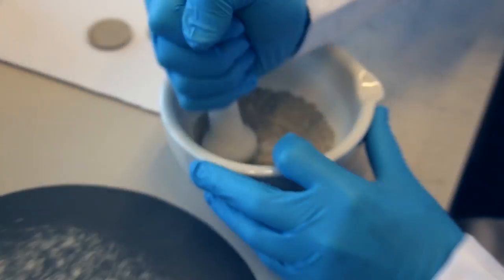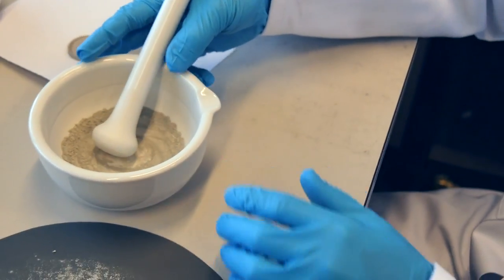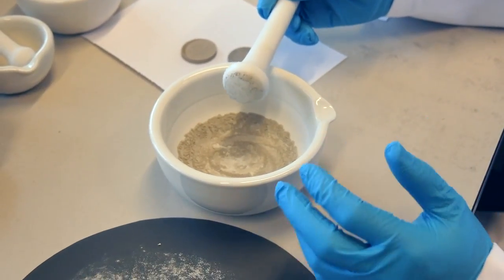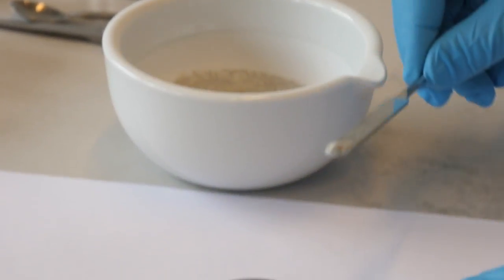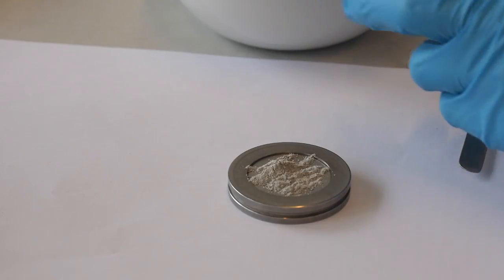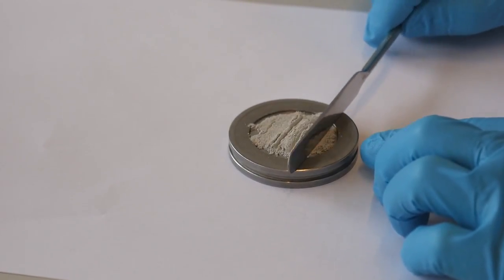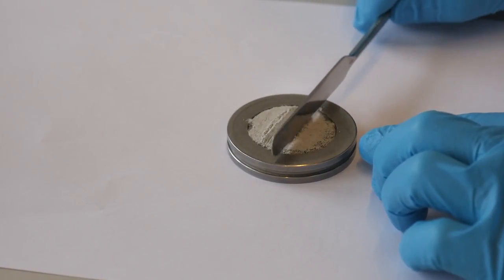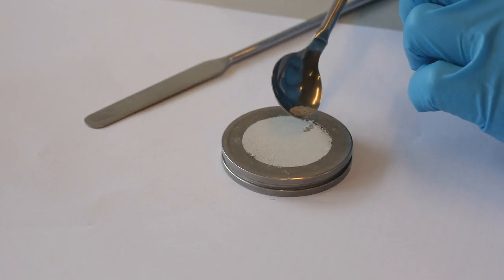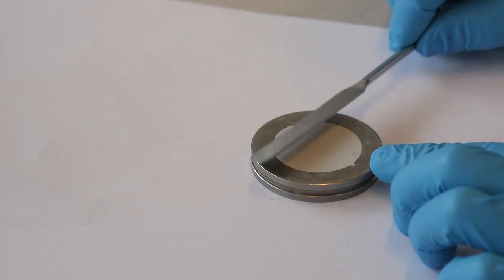For dried hydrated cement, the surface as well as the edges of the sample should be removed because they can be carbonated during storage and sample preparation. Front loading is the most widely used sample preparation method, because of the simplicity of the sample holder and sample preparation, even though it is not the best. Take the sample and distribute it into the cavity. Spread the sample in the cavity with the edge of the spatula. At the end, plane the surface of the powders, making sure the surface is smooth and the powder is well packed.